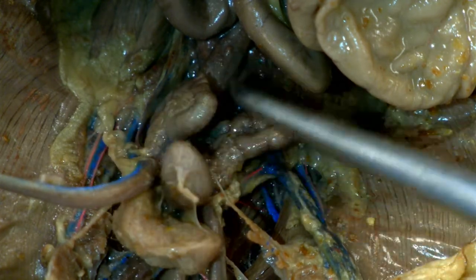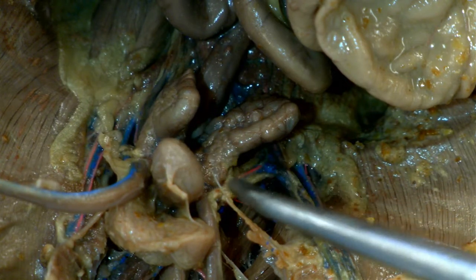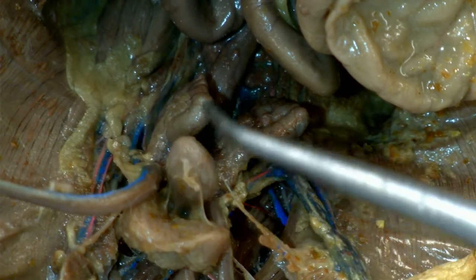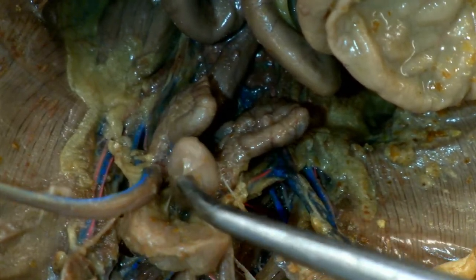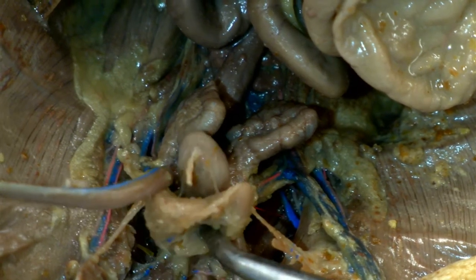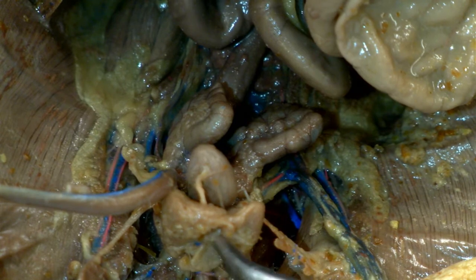Both of these glands lead into the penis, along with a few other structures including this one. This structure is not a gland — this is the rat's urinary bladder. Rats don't hold a lot of volume; this is probably less than one milliliter. Also in this region is another very important gland: the prostate.